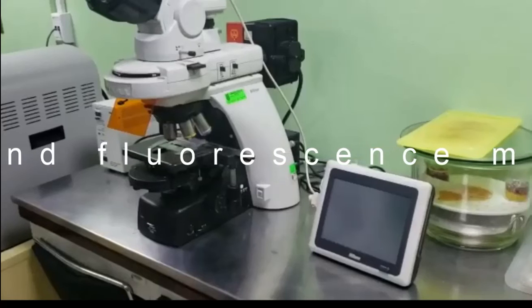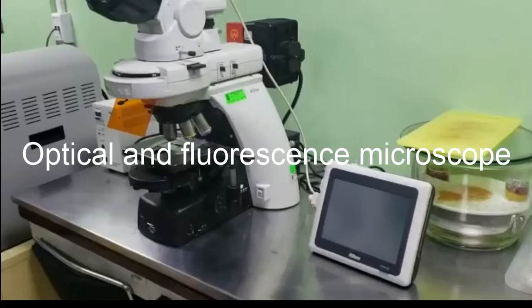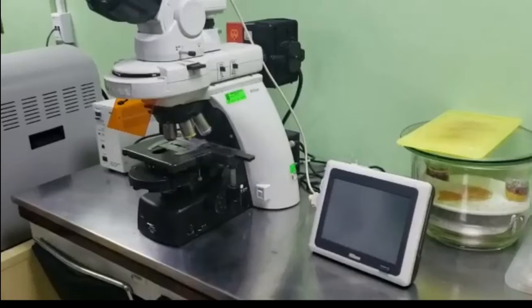In this opportunity, I want to present the optical and fluorescent microscope that we have in the laboratory. This microscope is a vertical instrument in which we can observe different samples. We normally use this microscope to observe biological samples prepared before we observe them in the confocal or in the AFM. Also, we try to use this microscope to verify that we have the samples, for example, cells or nanoparticles, in the media that we prepared before we use it in other microscopes.